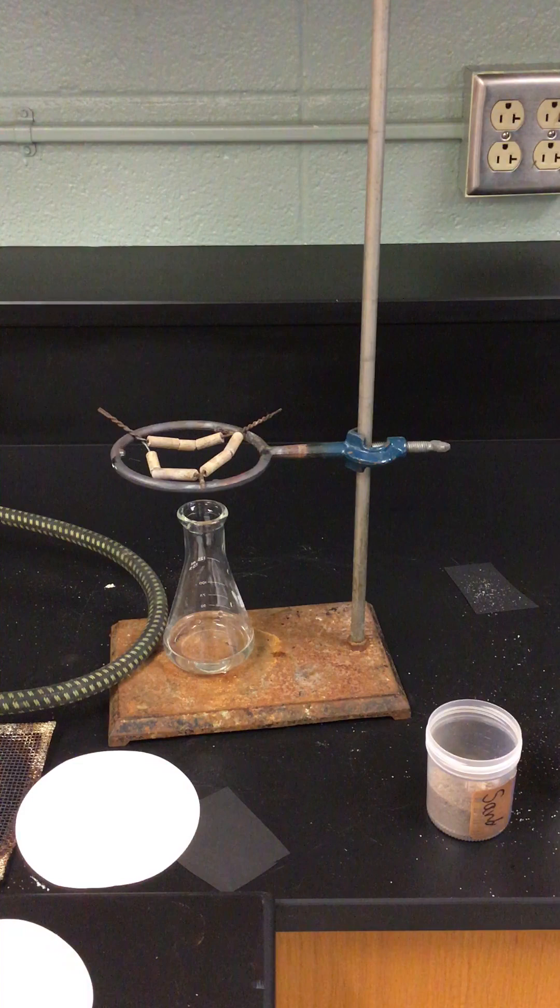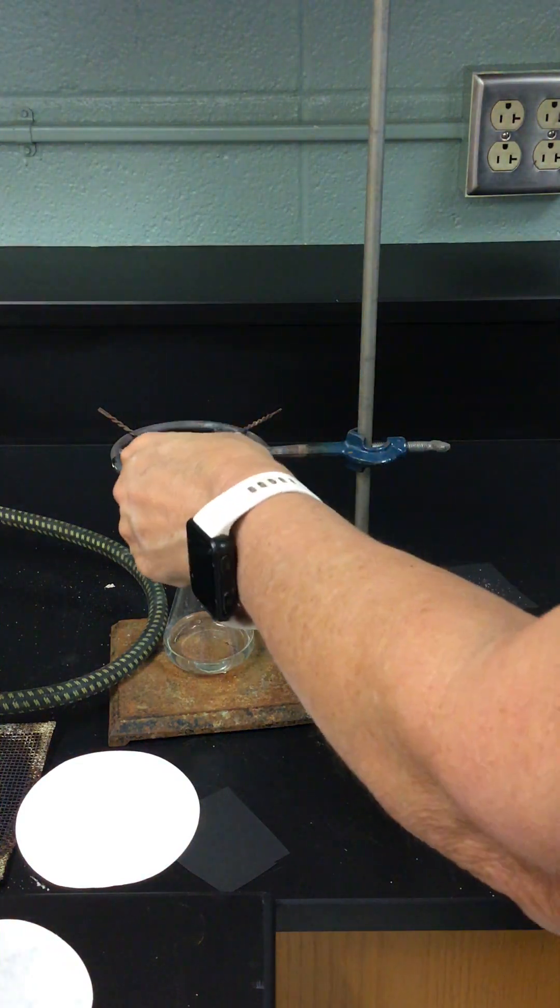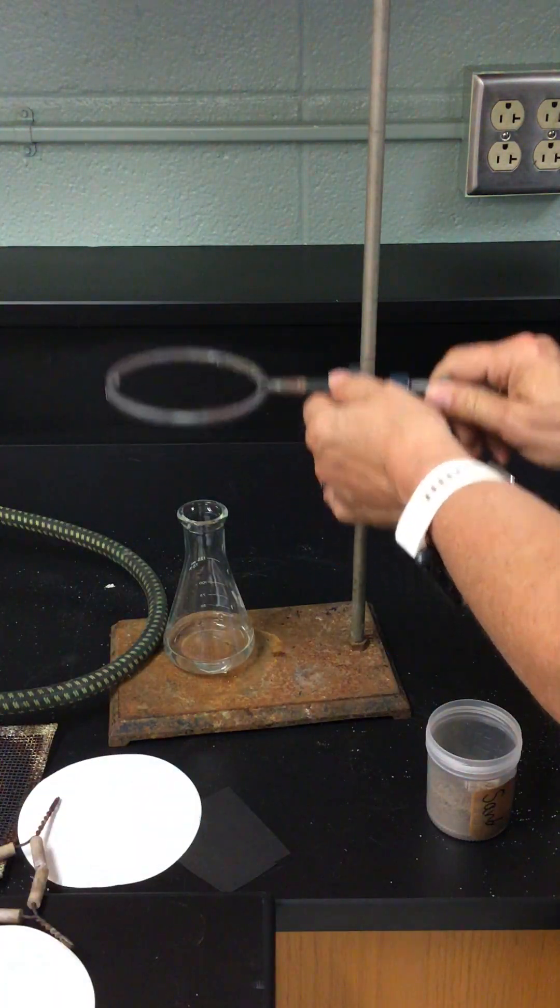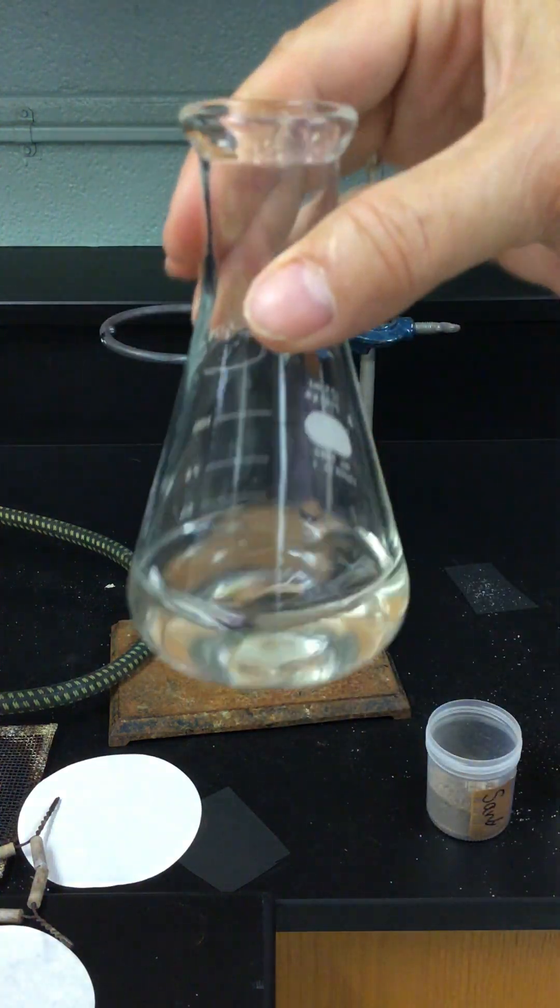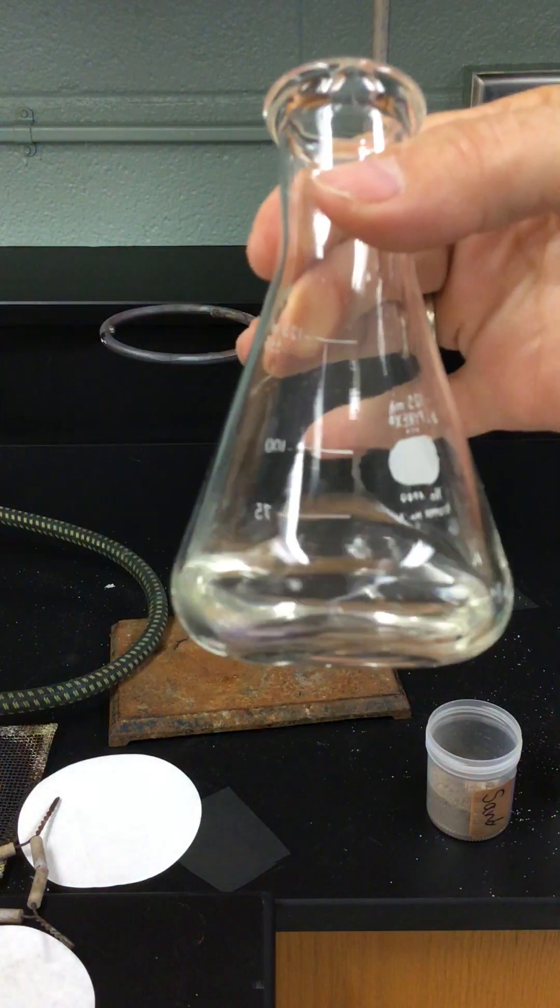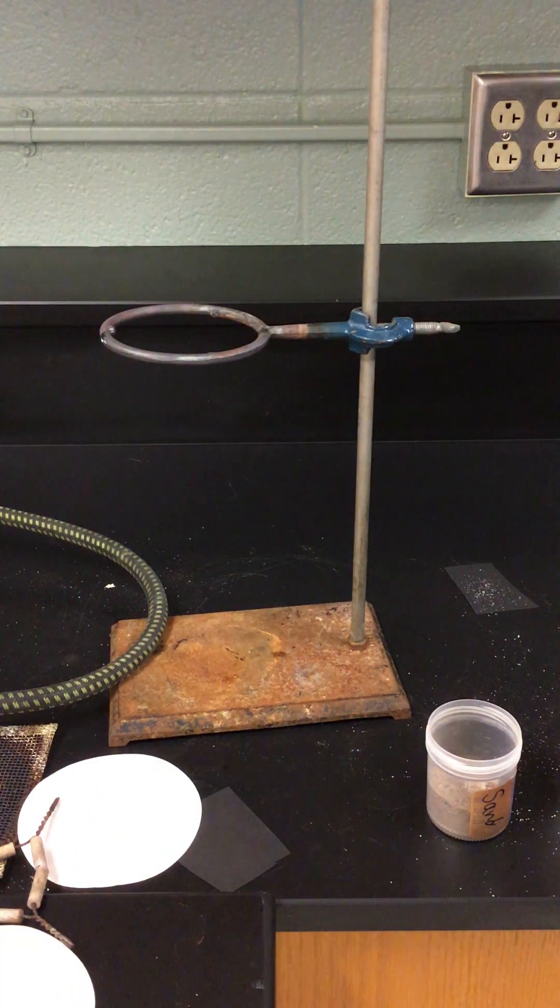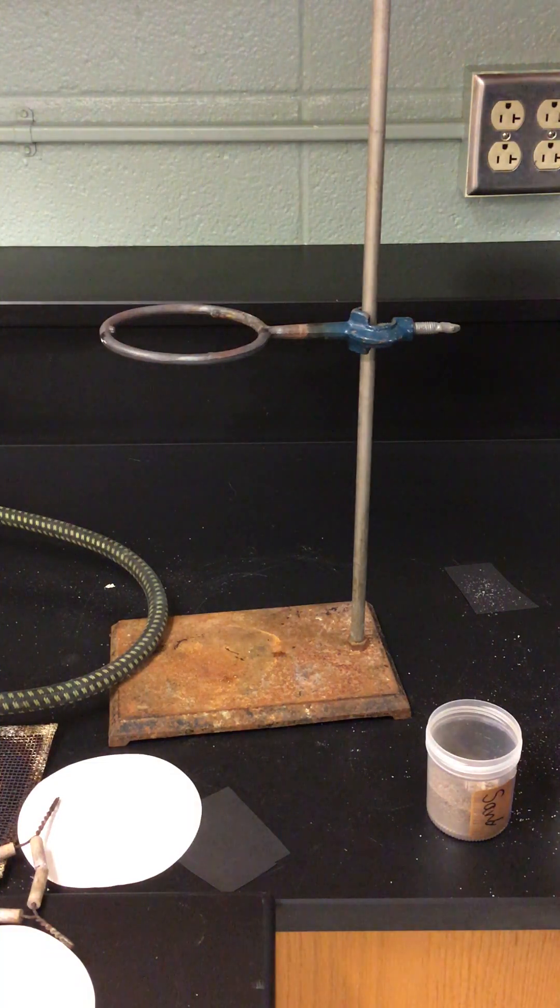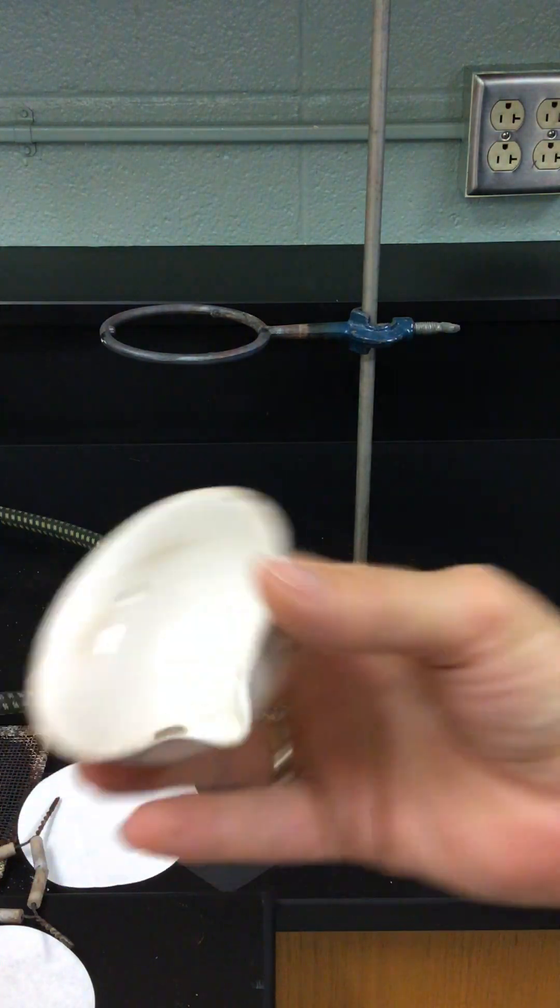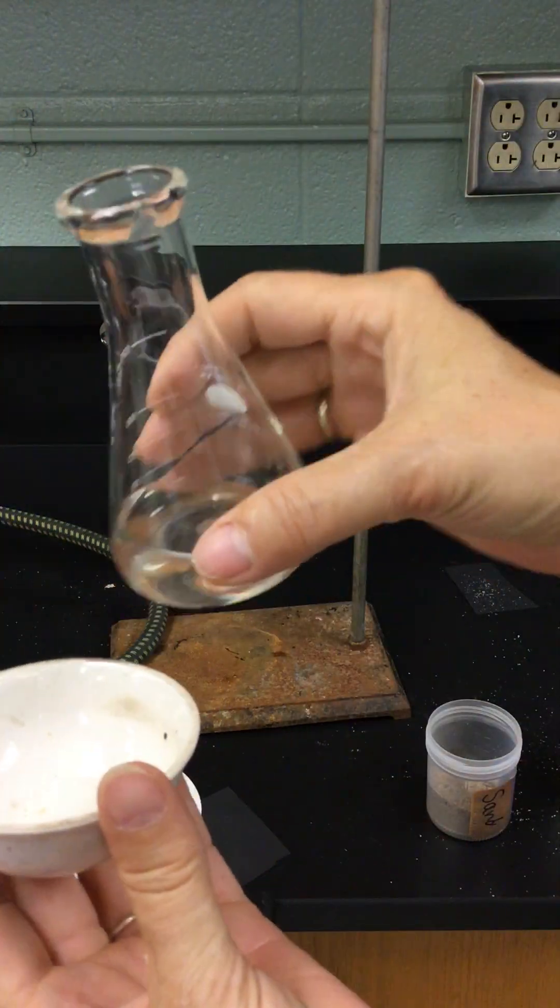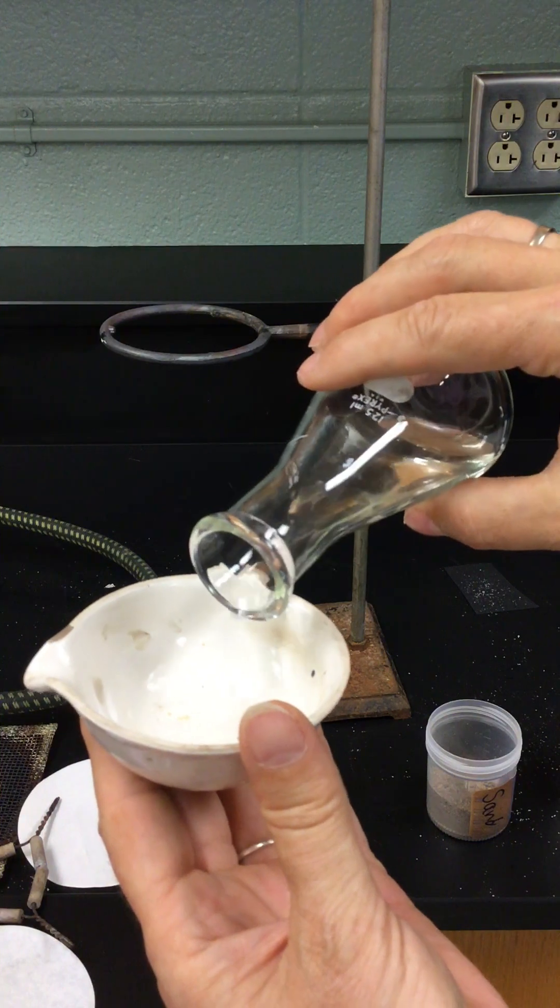We're going to consider the rest of this. I have filtrate in here, it looks exactly like water and we know that water is part of this. We are going to put some of this filtrate into an evaporating dish. This is an evaporating dish.